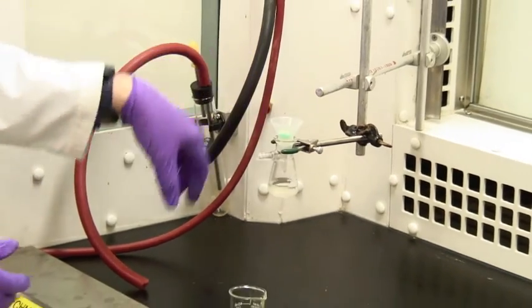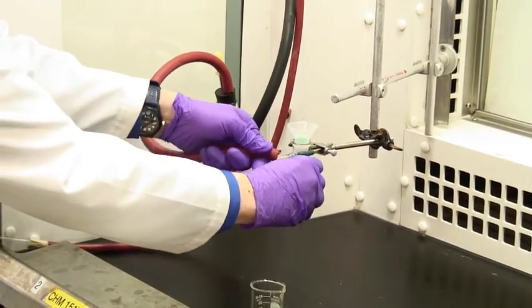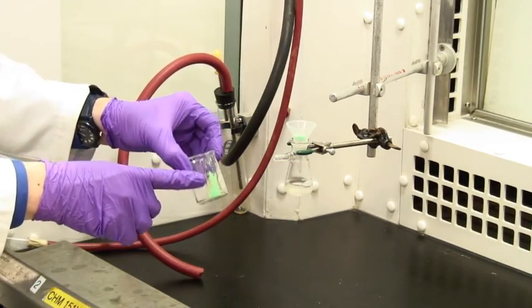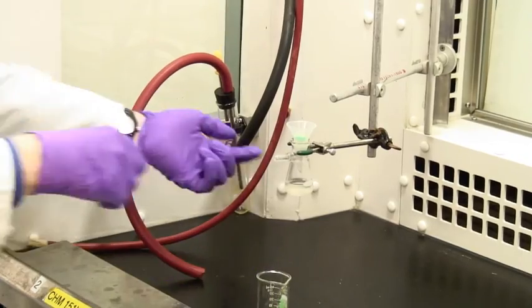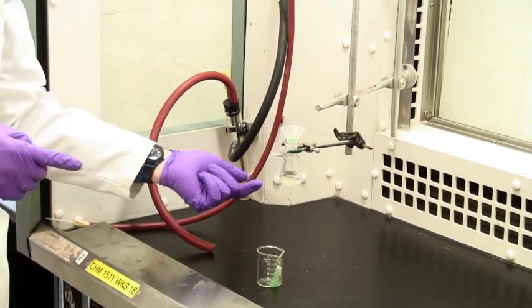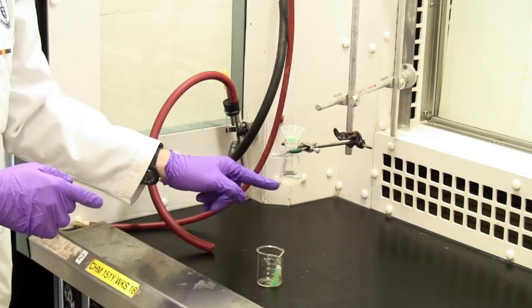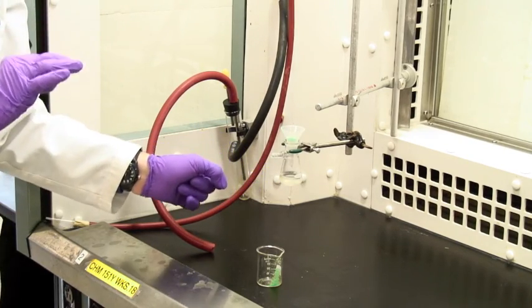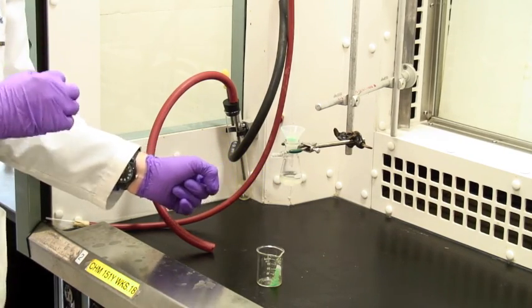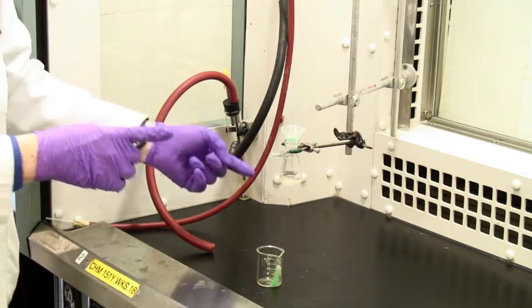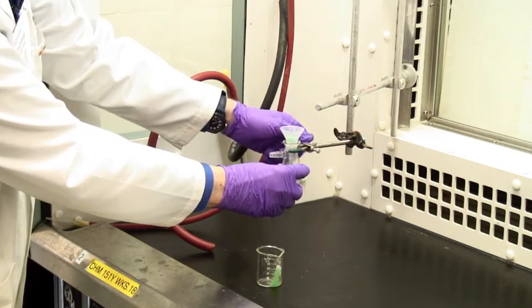However, quite frequently what you're actually looking for is the solid. If that's the case and you've still got some solid in the beaker, you'll need to use this liquid here. You could use any liquid to transfer it but this liquid here is already a saturated solution of your product and so you won't lose any more if you use the filtrate which is the liquid that comes through.